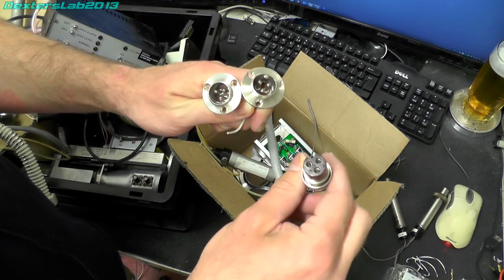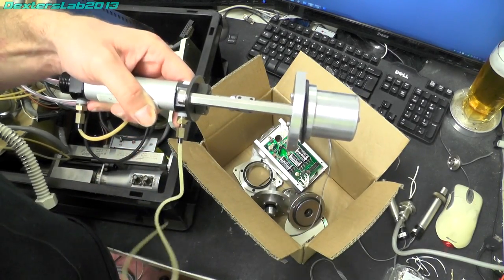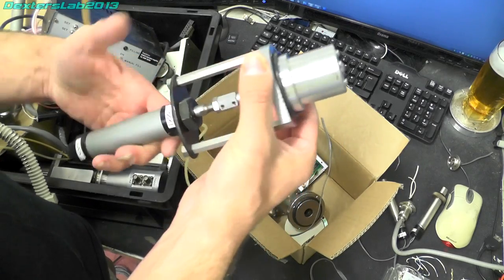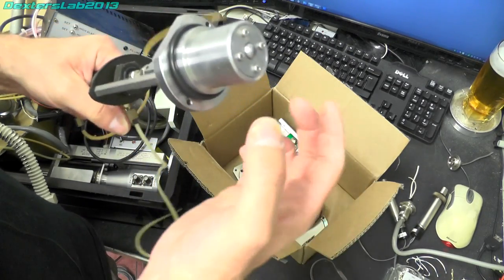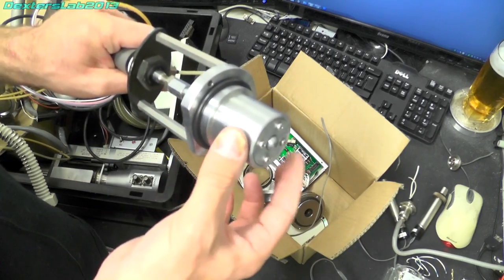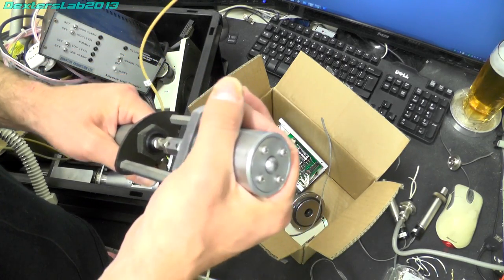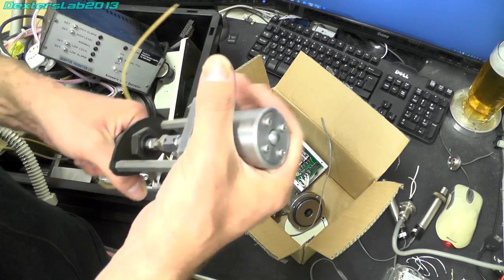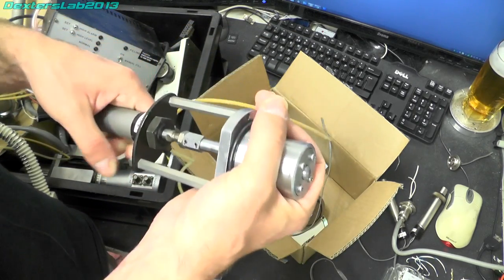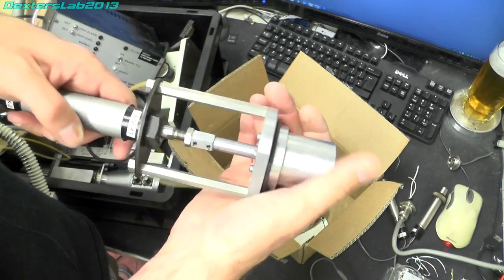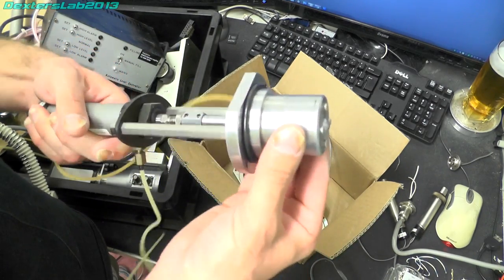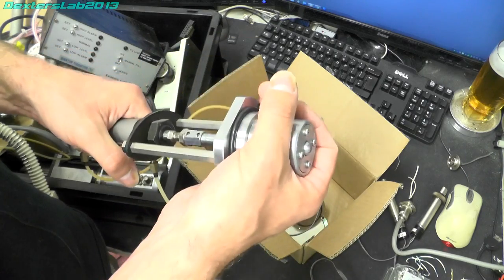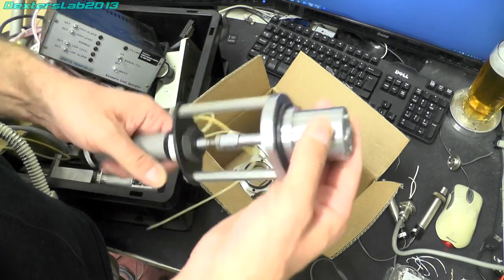This is one of the pneumatic pistons which I think locked the sample table into place. So it was really rigidly mechanically locked to the sample chamber itself. Presumably for doing really high magnification stuff, stops the table and the sample moving around while you're trying to look at it.